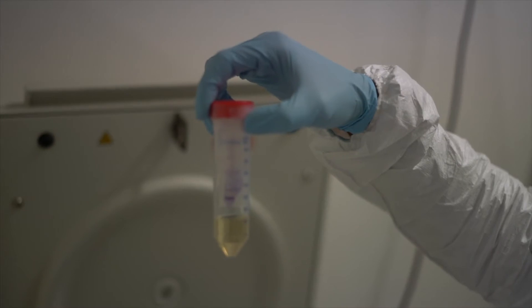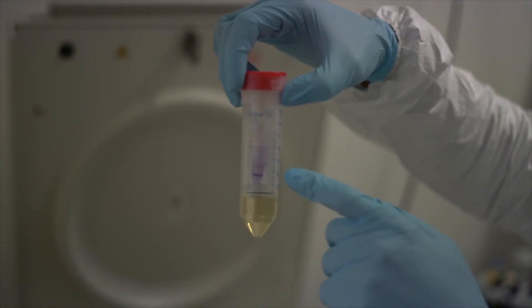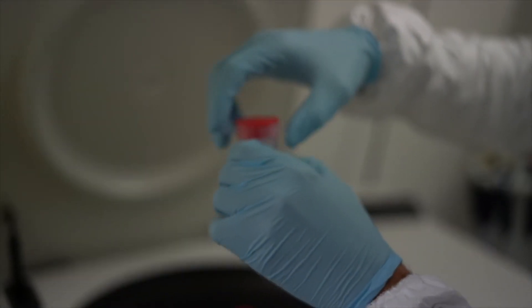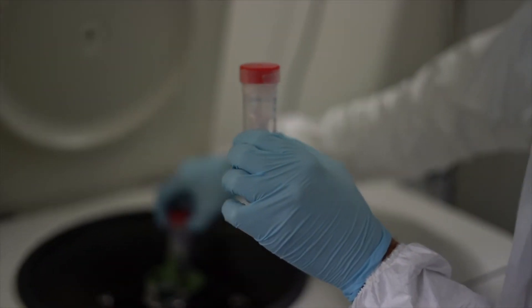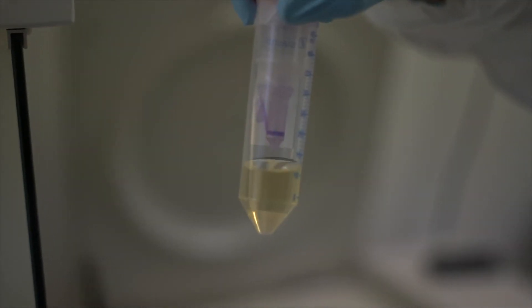We can see everything has flowed through, well not everything. You can see there's something still in the MinElute column, but that's fine. At least the Zymo reservoir is empty. Well here the same. Here even the MinElute silica column is empty.